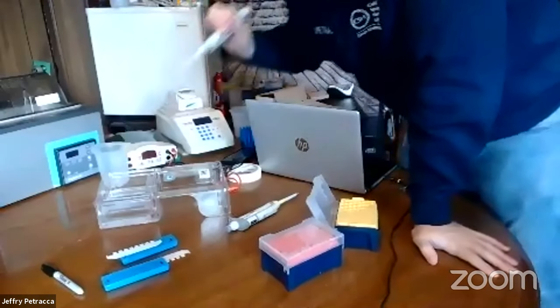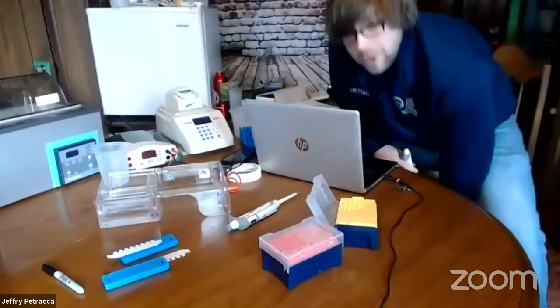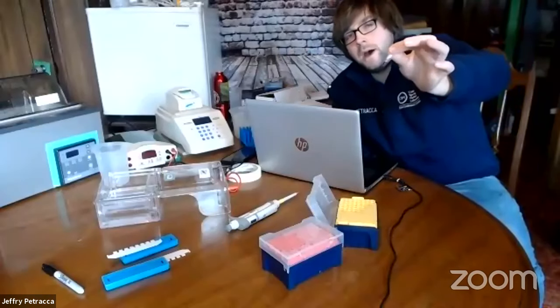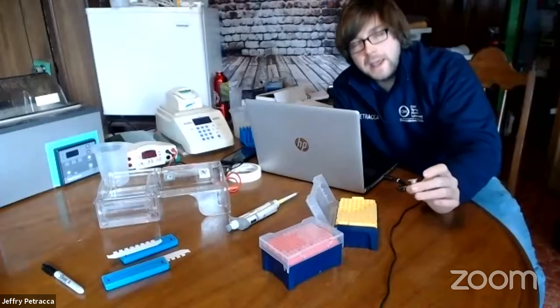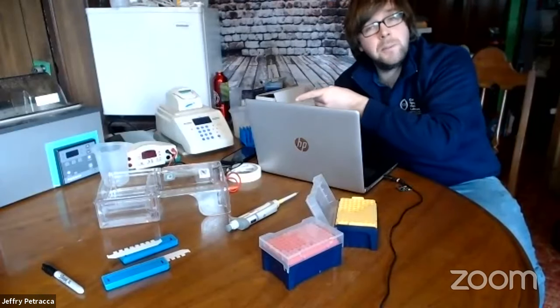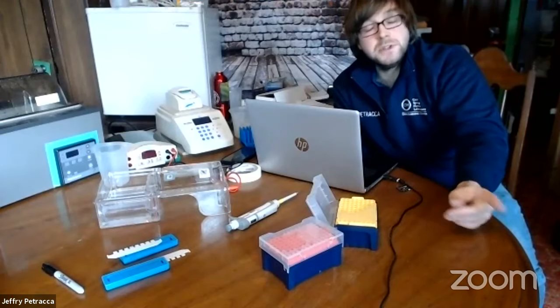I'm not too sure how big those fragments are yet, but we're going to find out. What we're going to do is run a reference marker. In this tube I have what's called a 100 base pair ladder — a mixture of DNA fragments of specific sizes. It contains pieces from 1000 base pairs all the way down to 100, in 100 base pair increments. It's kind of like a DNA ruler. If we compare the run pattern of our ladder to each of our individual samples, we'll be able to estimate the size of each one.